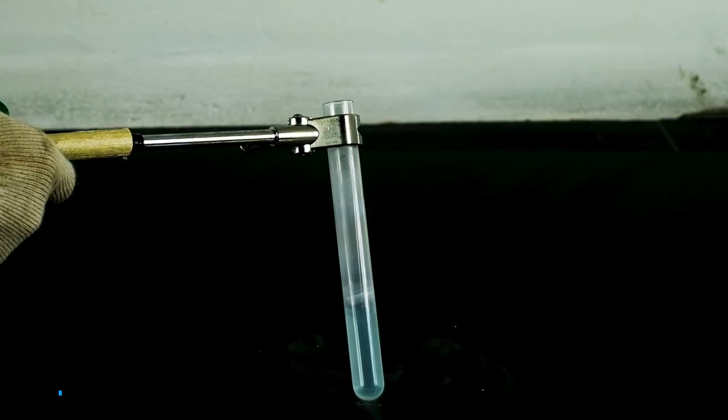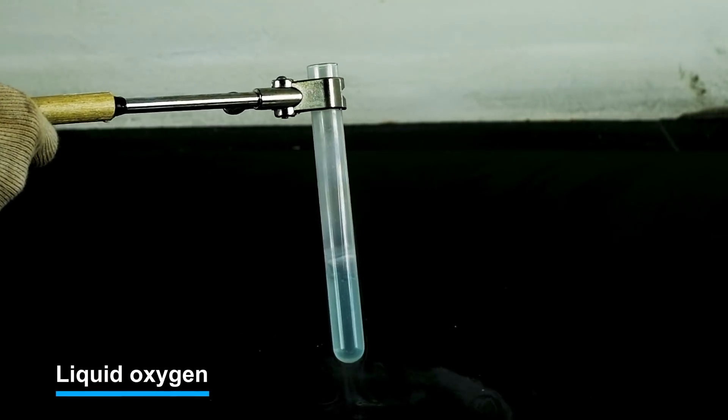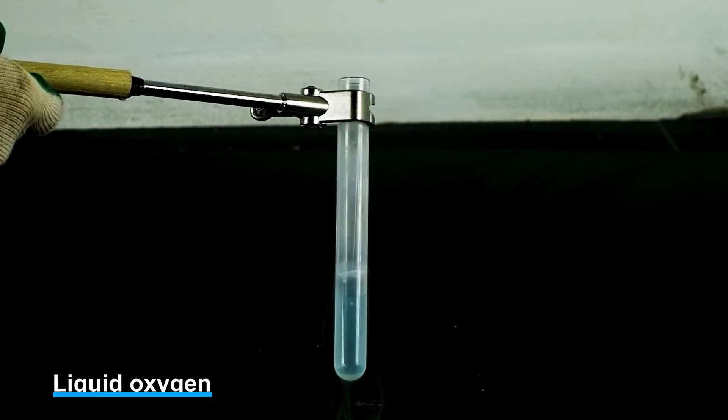For this video I chose organic liquids from my arsenal that differ from each other as much as possible, so that the reactions will not be similar.